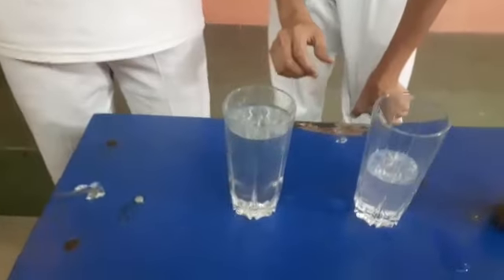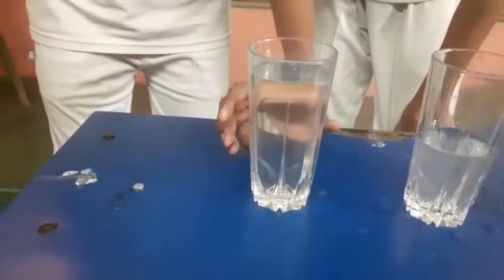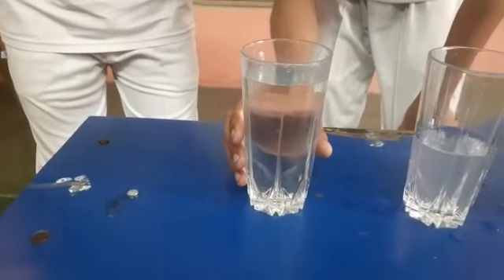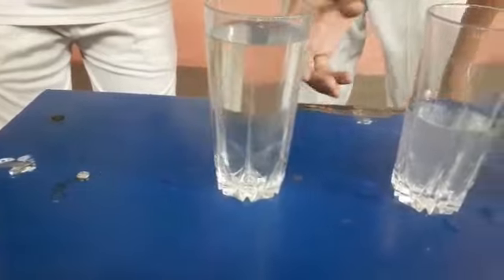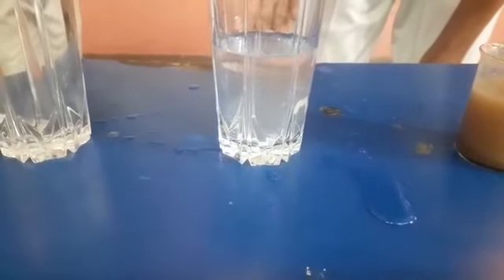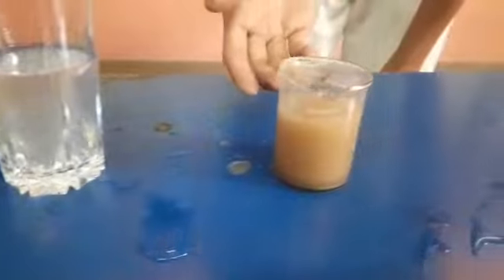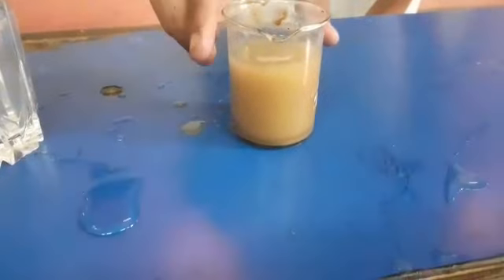It has been an hour, and now we can see through the solutions. This is the sugar solution and it is quite stable — very stable. This is the soap and water solution and it is very stable. That is the sand and water solution and it is very unstable. As you can see, the particles of sand have settled at the bottom of the beaker. Thanks very much for watching.